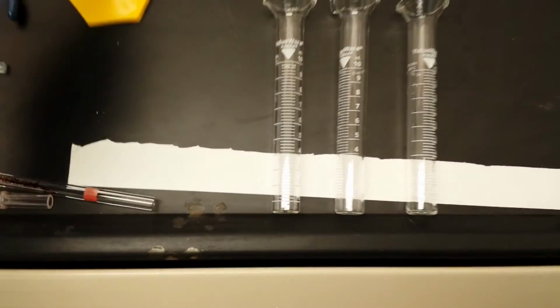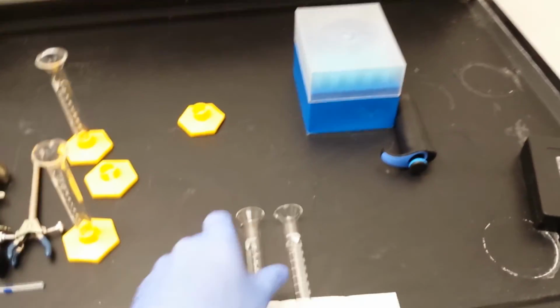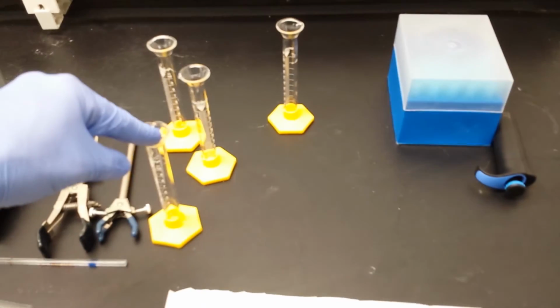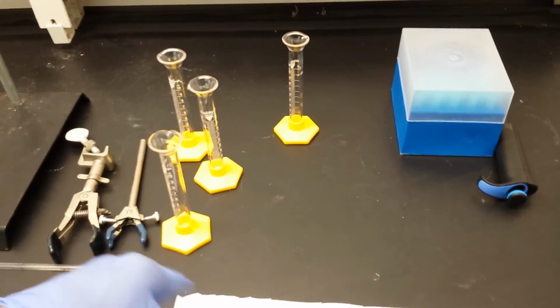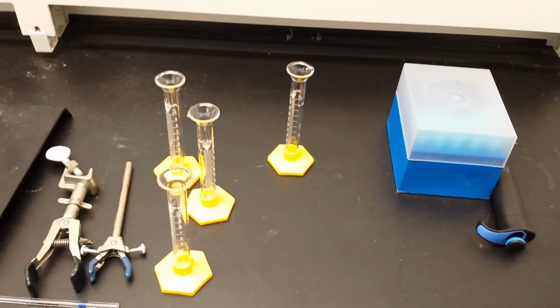That's great when you're doing a lot of organic reactions, because you just need to have some idea of how much excess reagent you've got to make sure that you put in enough, but you're not wasting a small fortune. That's really about all that graduated cylinders are good for. Holding some solution before you dump it in without caring too much about the real volume in it. So be very careful. Don't start calling these real volumes, or I'm going to have to make fun of you.